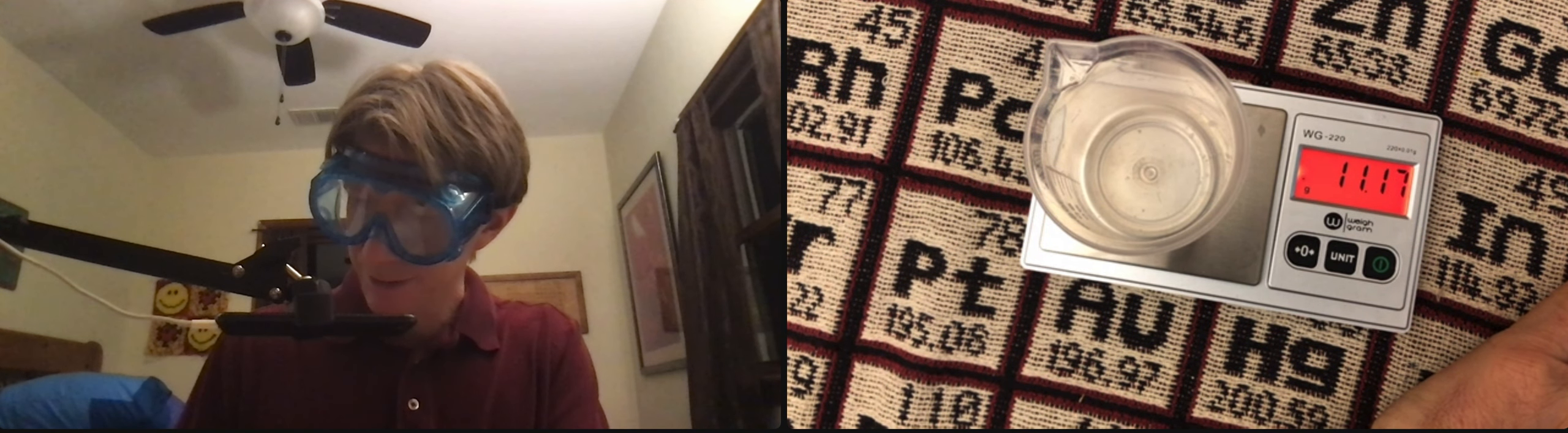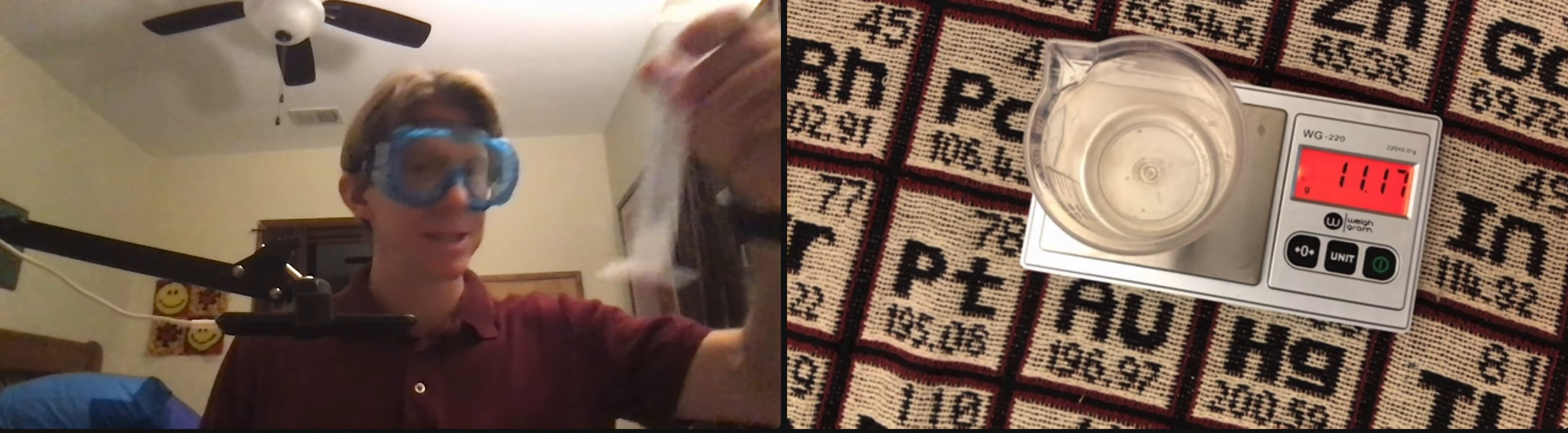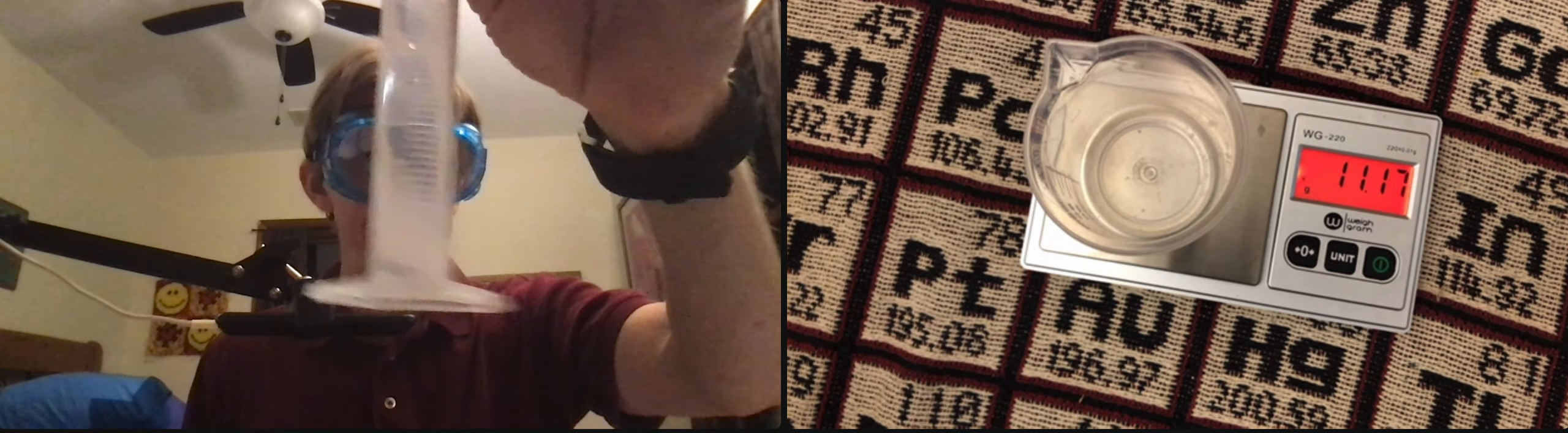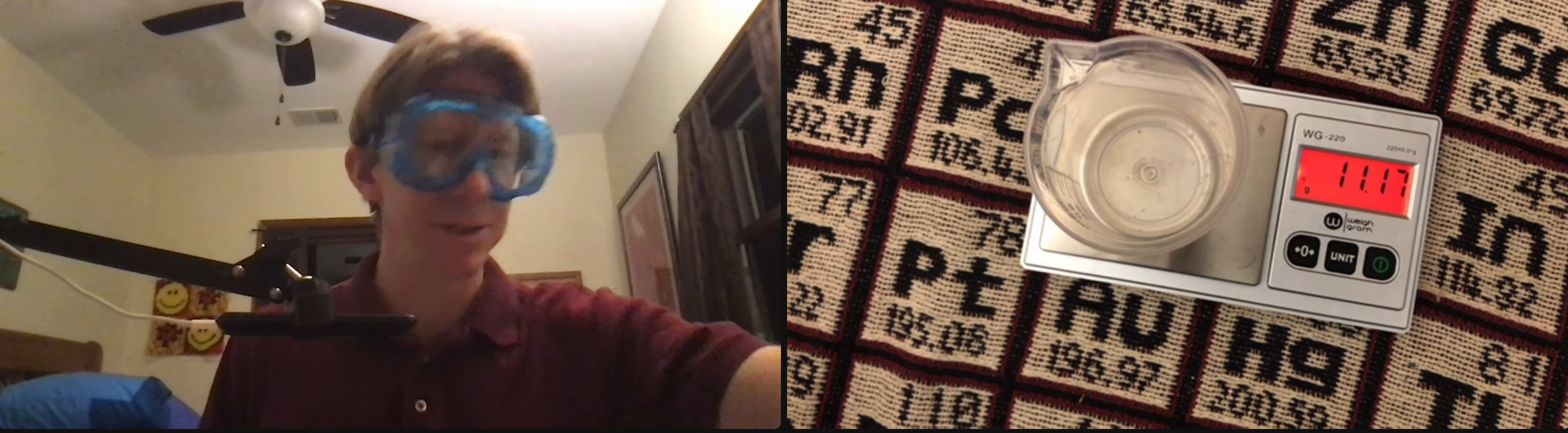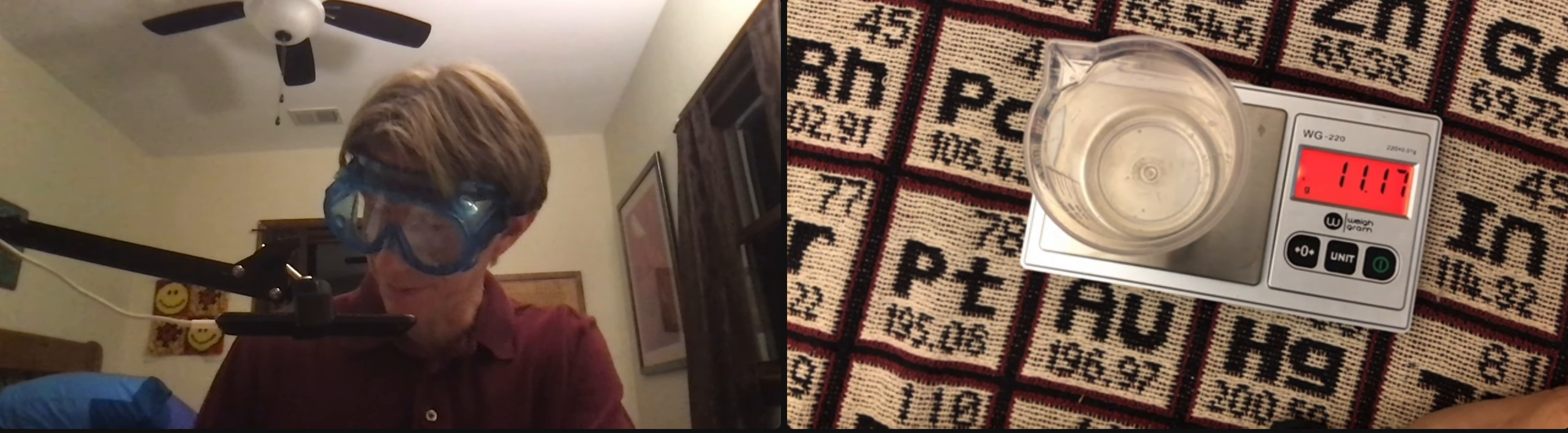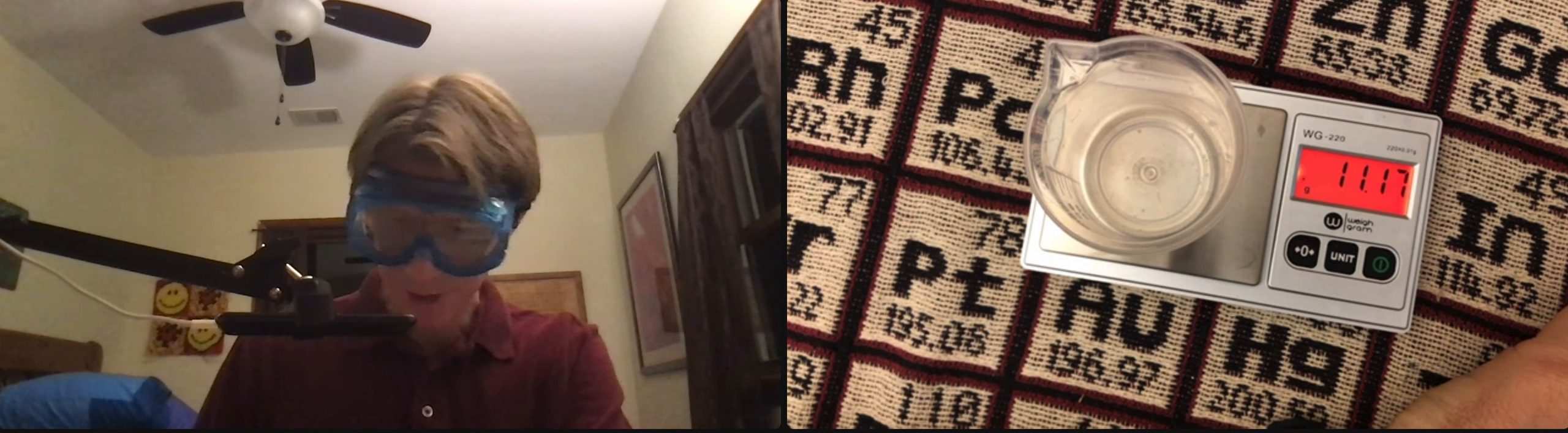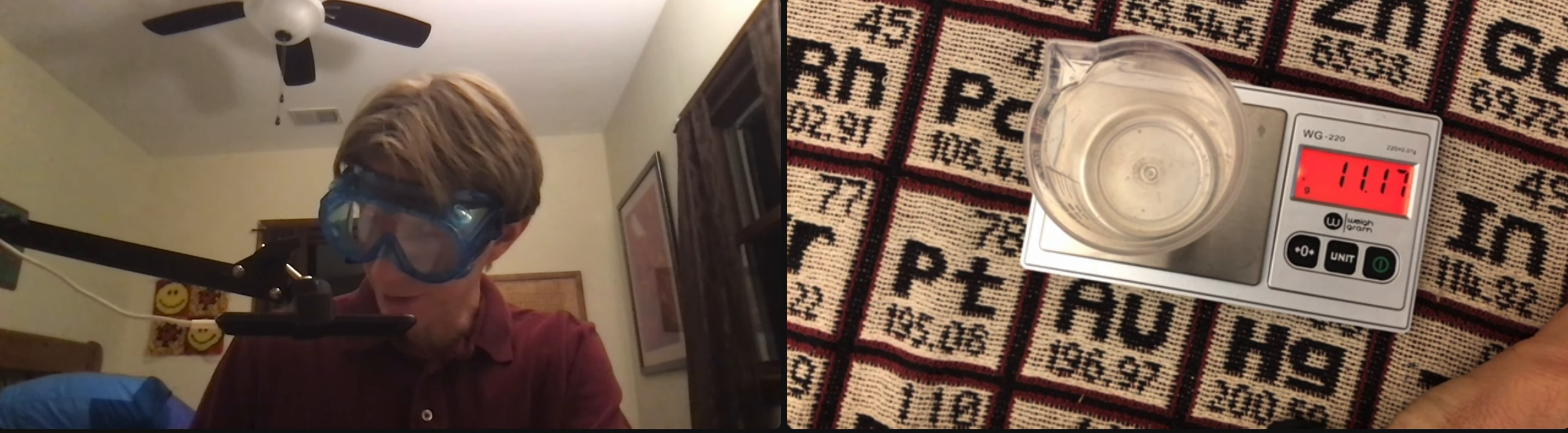As I do this, I've still got bubbles of my 8 centimeters of magnesium, so I'm still waiting for that. Mass of the beaker, 11.17 grams.